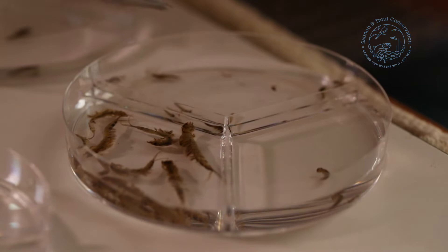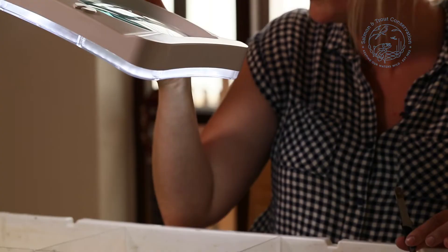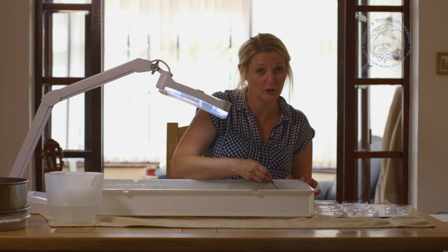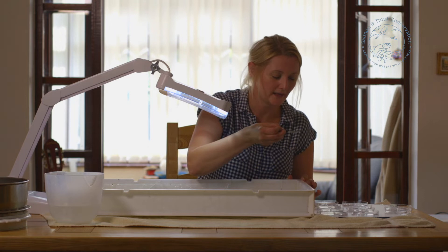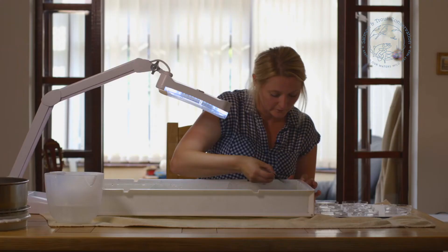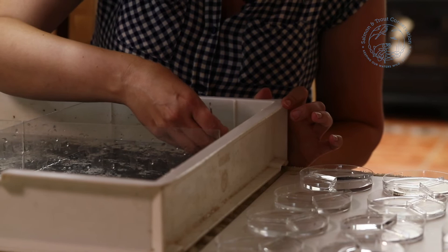So I'm going to go through carefully. I need to bring my light over — we've not got enough light over here. I'm just gently moving away any matter that might be hiding the animals. You need to be very careful because as these have been preserved, they're no longer living and moving. You need to really get your eye in for the kind of things you're looking for. I've just pulled out a very small mollusc which would be really easily missed if you weren't looking carefully.